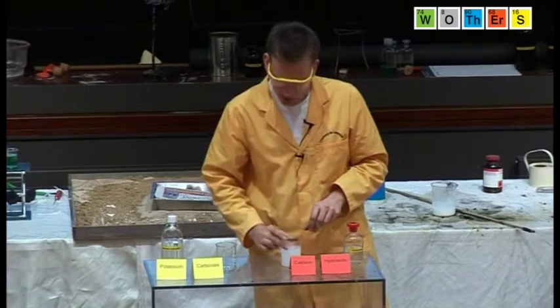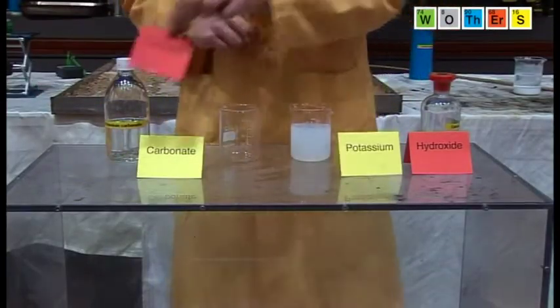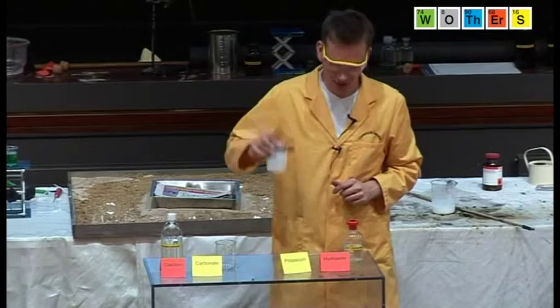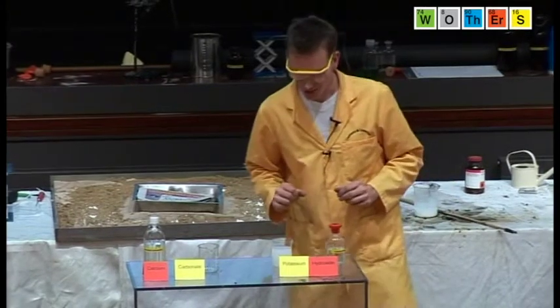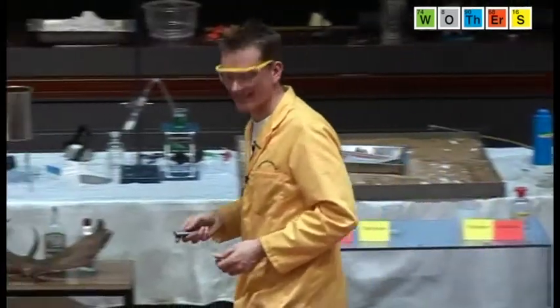It reforms. So what happens, let me see if I can swap these round like that. Okay, and we end up with calcium carbonate. That's the white colour that you see. And in solution, we have potassium hydroxide. And this was called caustic potash. Okay, and it was this that was first used to isolate potassium metal.